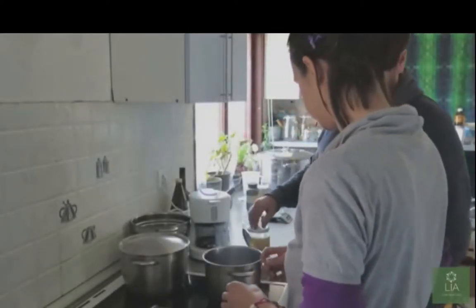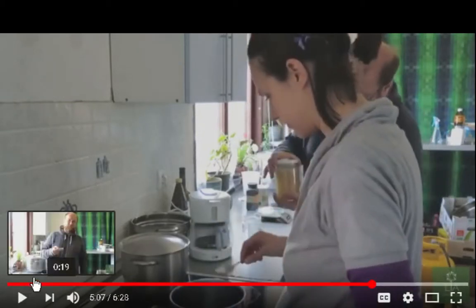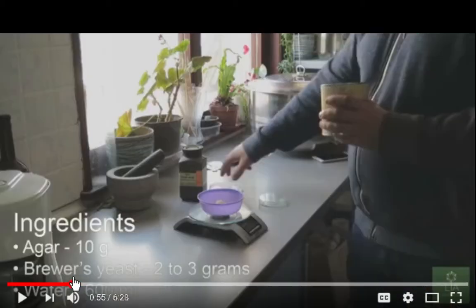I know that was 100 milliliters. They're using... oh wait, just a second now. There's a number here. Let's see. They're using 600 milliliters of water and 10 grams of agar.